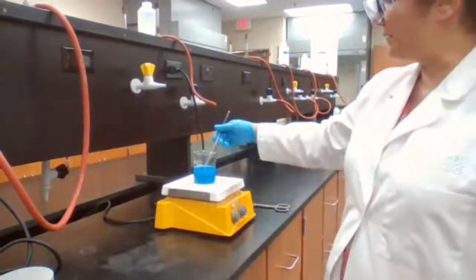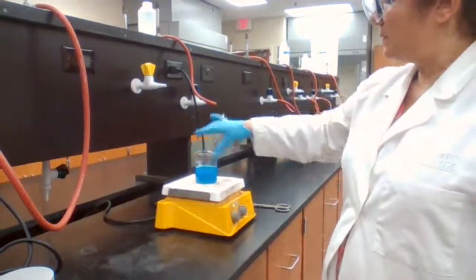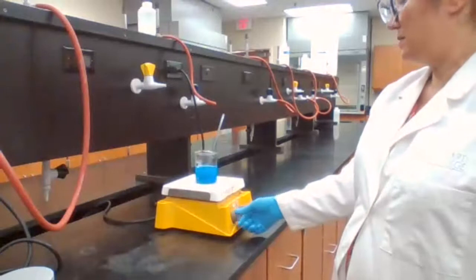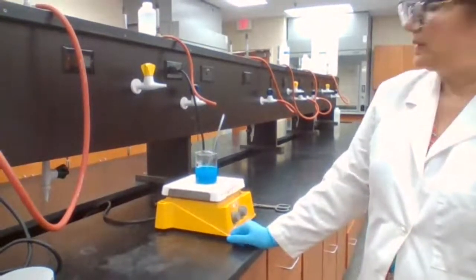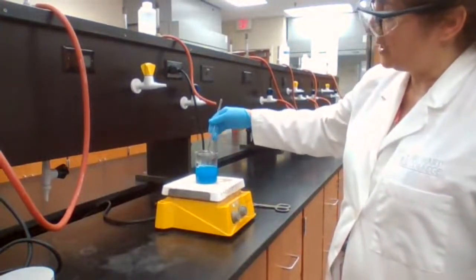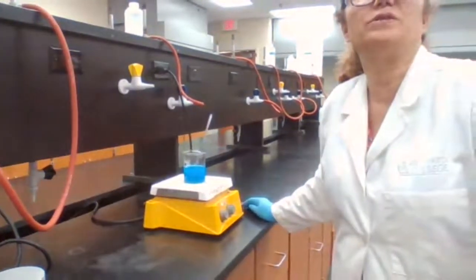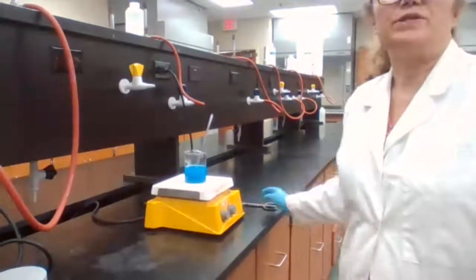It is another step of the oxidation, and removing water. Since it is removing water, you could classify it as a decomposition reaction because Cu(OH)2 is changing to CuO. Decomposition also.